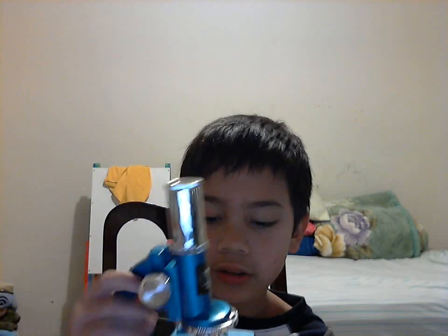You need to put batteries on it. And if you put batteries, it's gonna have light, that makes it easier. Just put this thing, like roll it up, and the light will turn on. Put it down to turn it off.